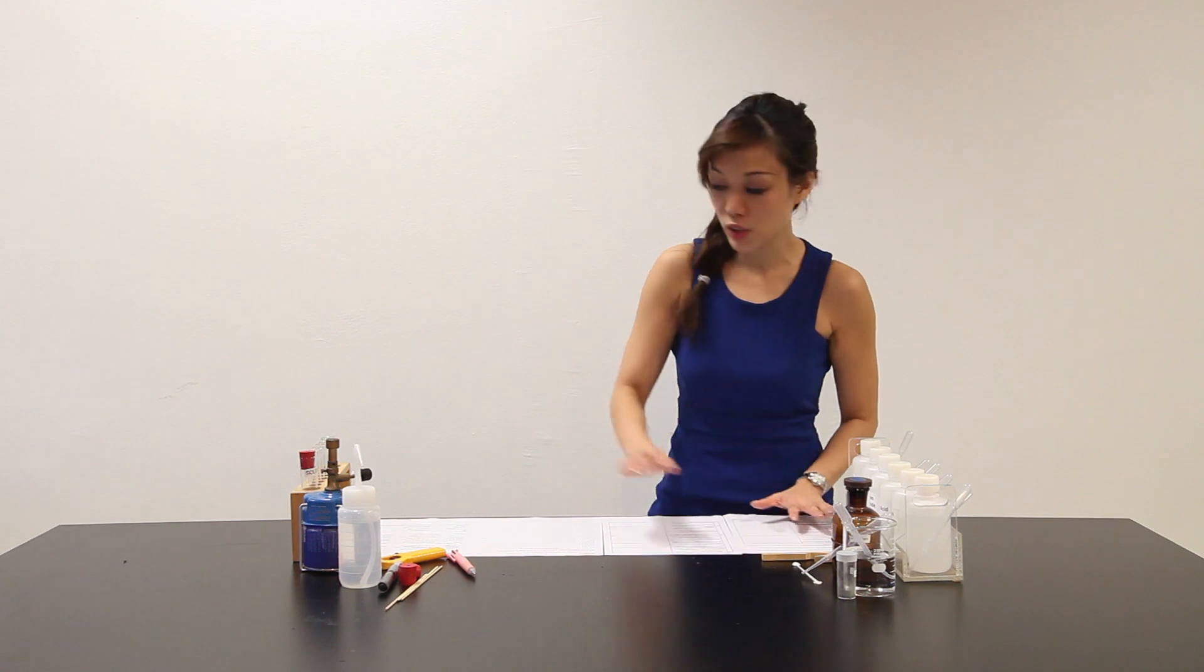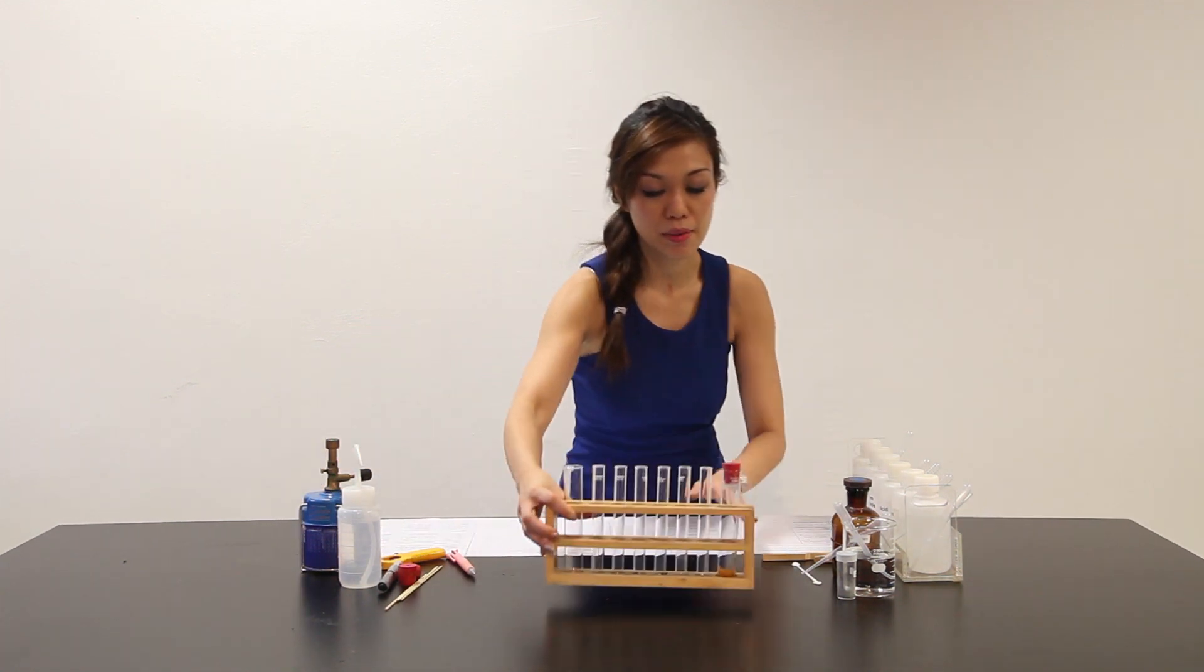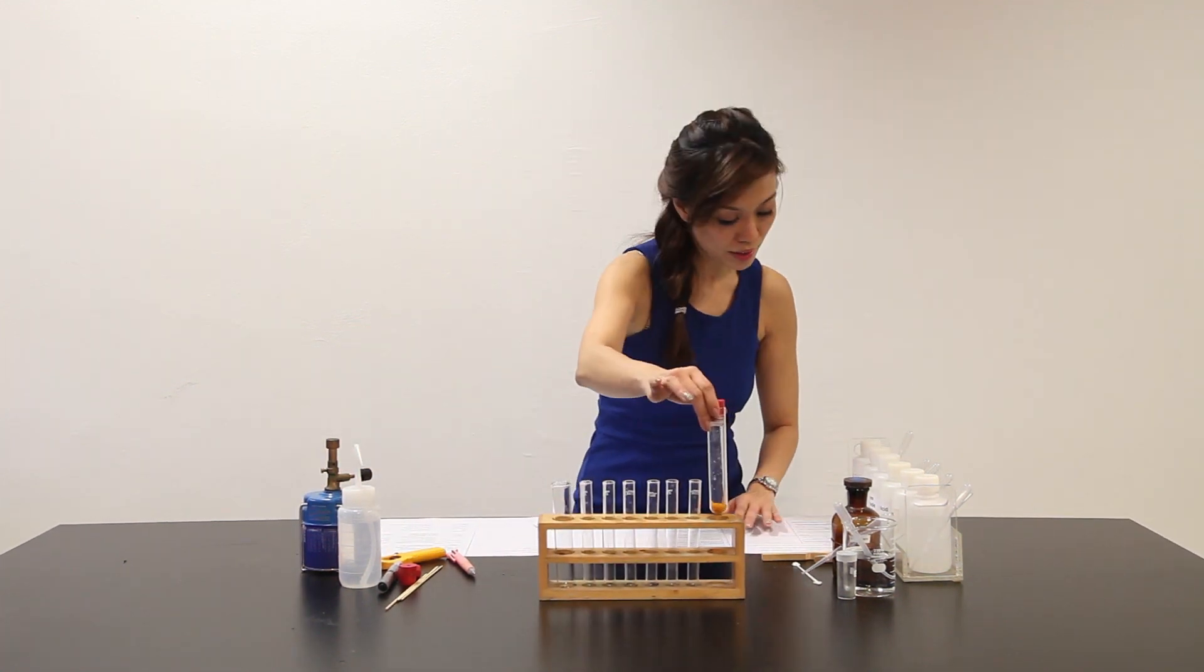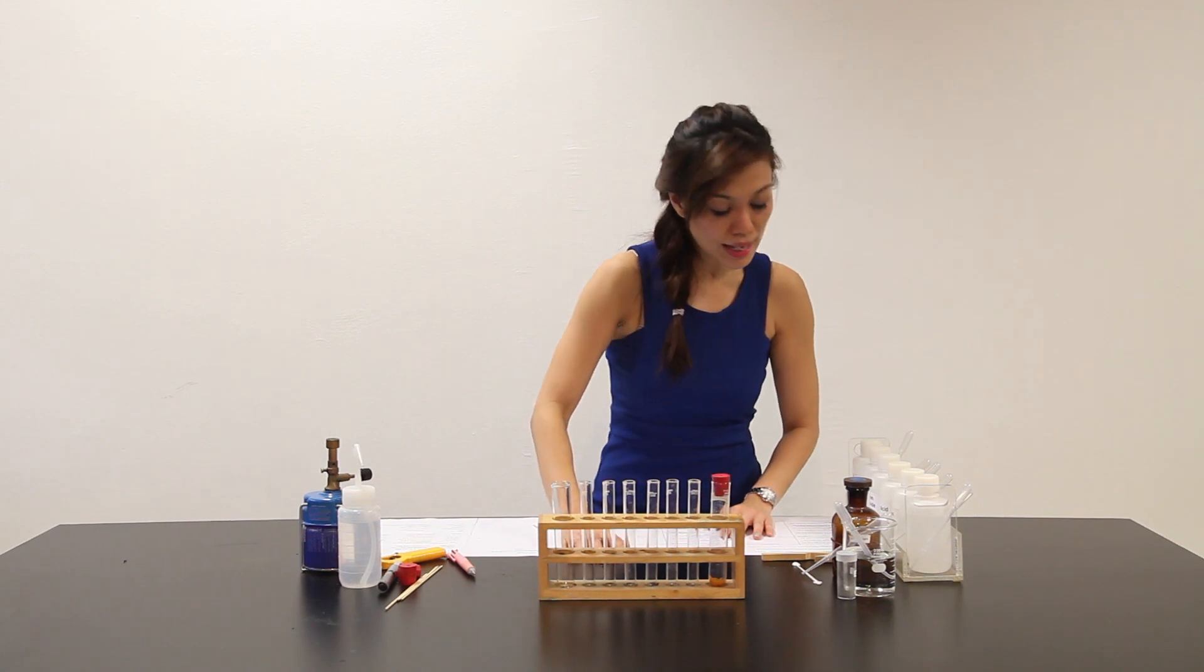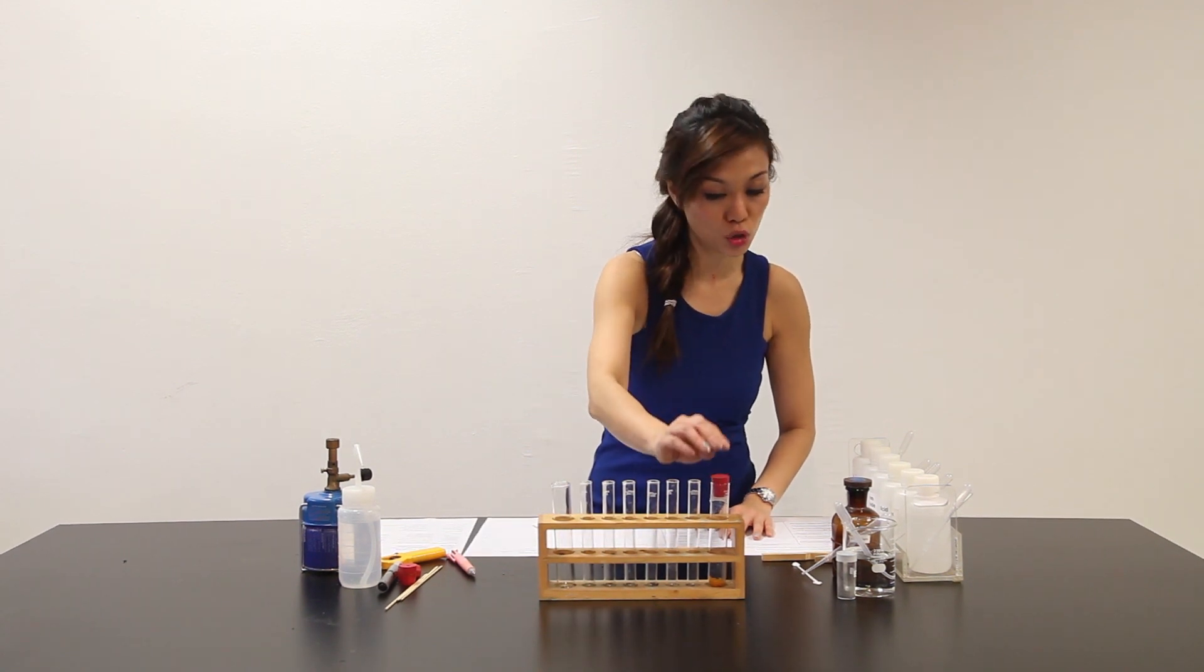You're provided with a sample of solid X. This is my solid X. It says here clearly that solid X is corrosive and should not be touched.